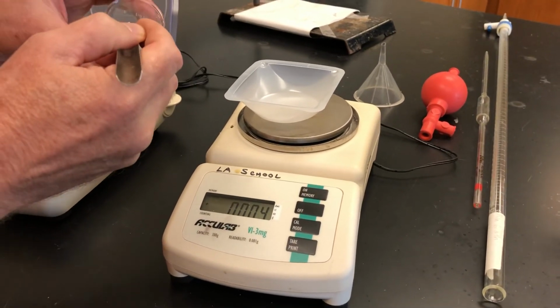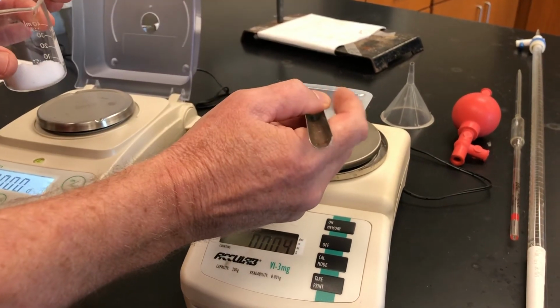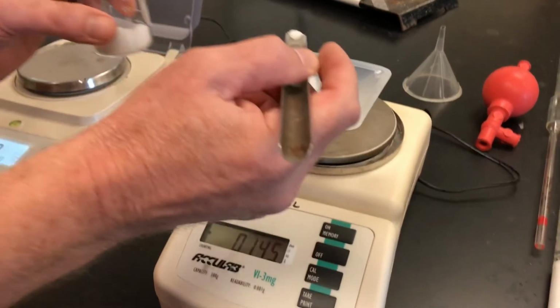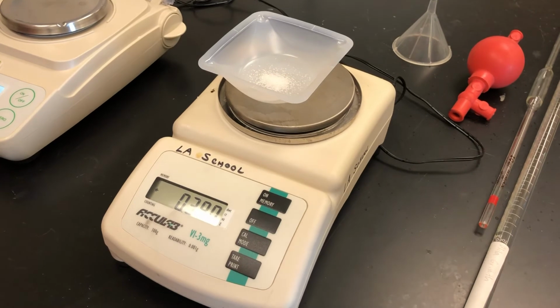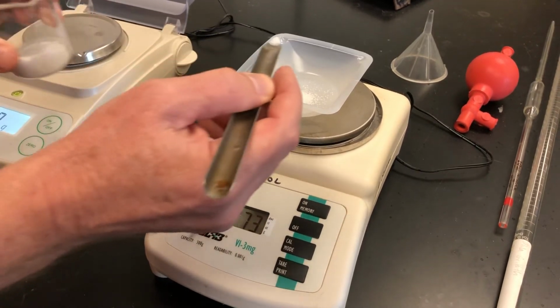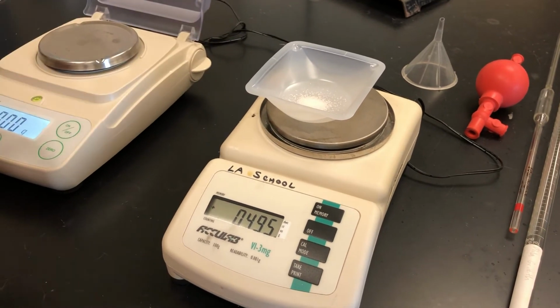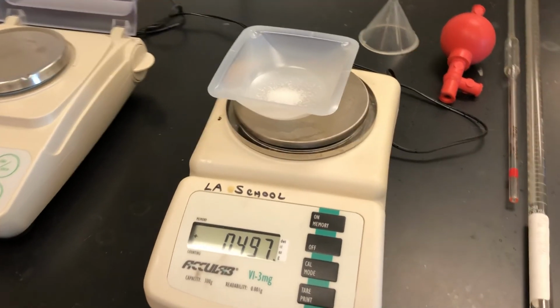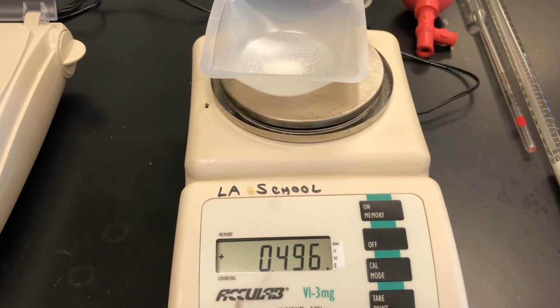Now, I have no idea whether this is going to be 0.5 grams or not, so that's why I'm using the spatula, and I can just sprinkle it in there, and you can already see that that's about 1/5 of the way to where I want to be. So I'm just sprinkling that in there, and I'm a little bit past halfway, so I'm just going to be a little bit careful on the next one here. Try to get off to the side so you can. Ooh, I'm not going to press my luck. I'm going to go with 0.497, and I'm going to call it right there, 0.497. It's not worth my time to chase that last decimal place. Okay. All right.